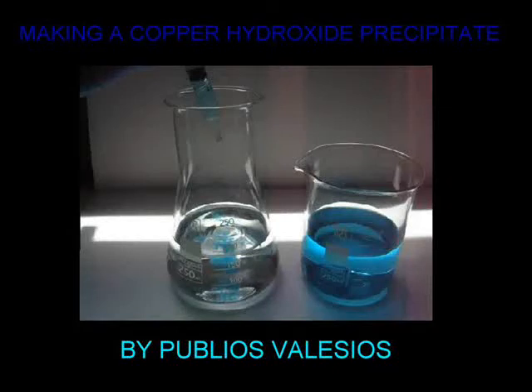Good morning. In this video I am going to show you how to make copper 2-hydroxide in a very simple way.